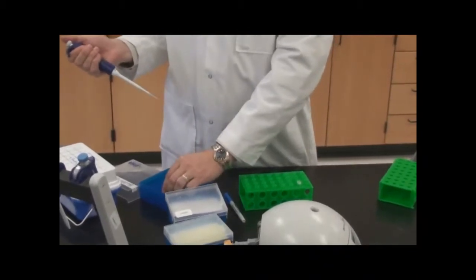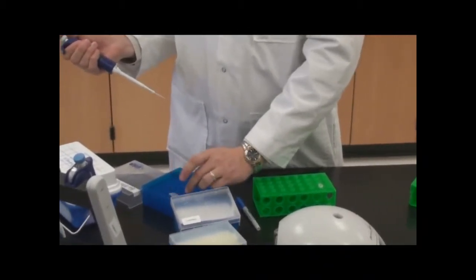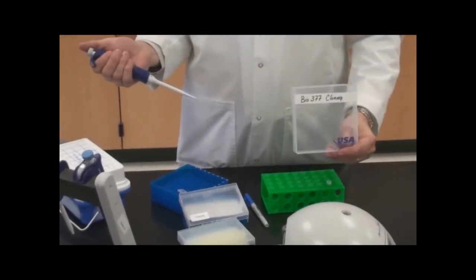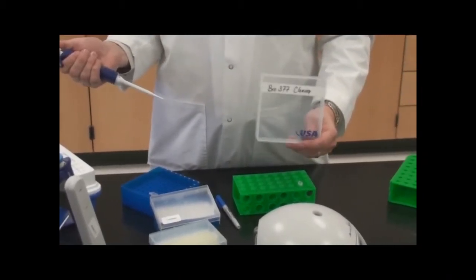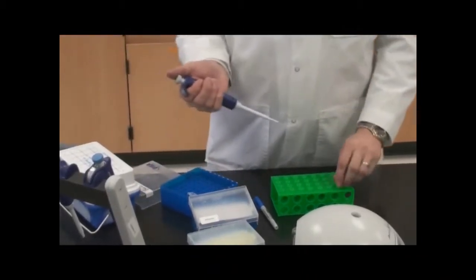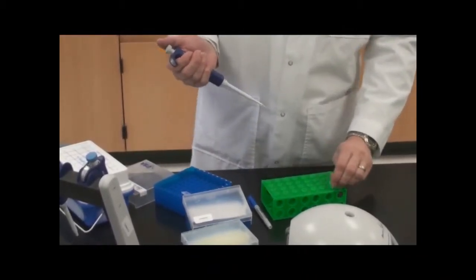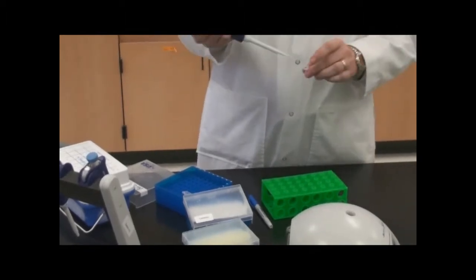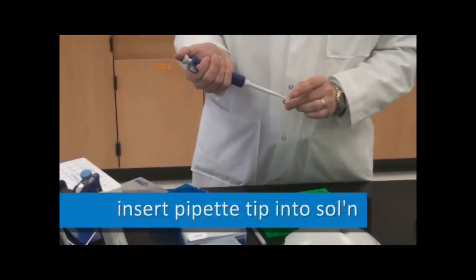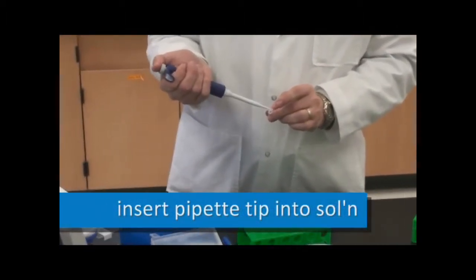I'm just getting the clean PCR and clean vector out of the Bio377 cloning box. It'll be back in the freezer, and this is where people will be putting their PCR and vector products after they've cleaned them. Now again, I'm going to insert the pipette tip all the way to the bottom of the tube.